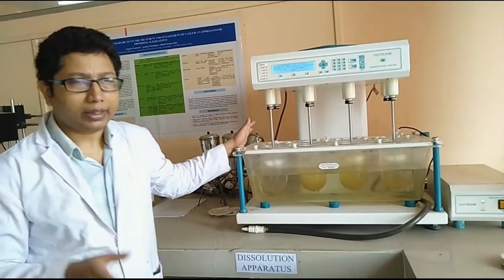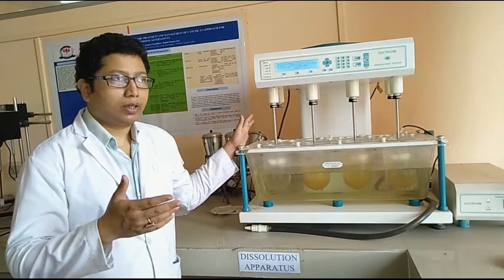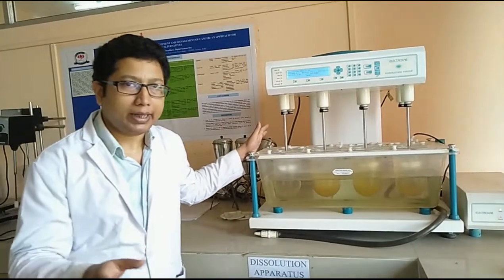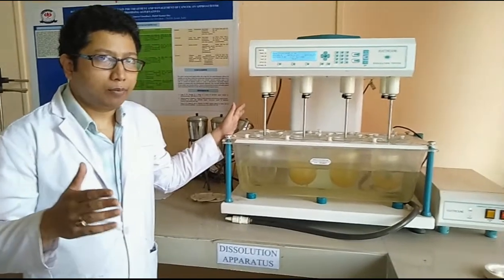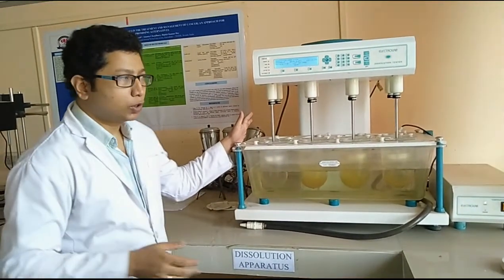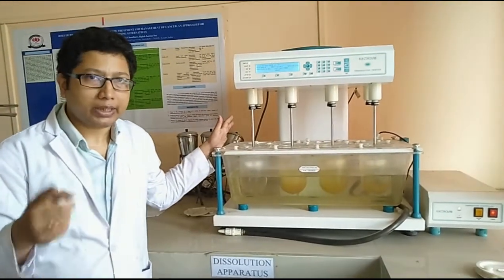However, for evaluation of a sustained release or controlled release product, the duration of the study will be higher, it may be more than 4 hours or even 12 hours. So based on the protocol, we have to continue the study as per our need.